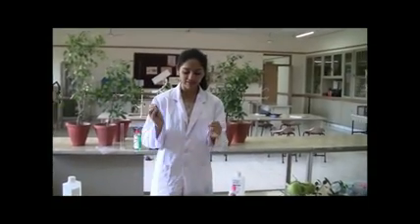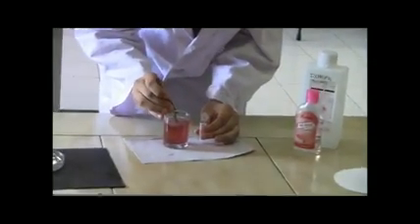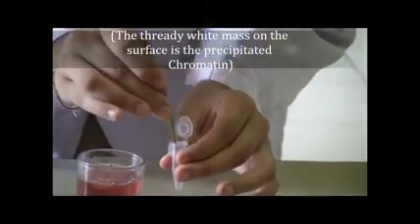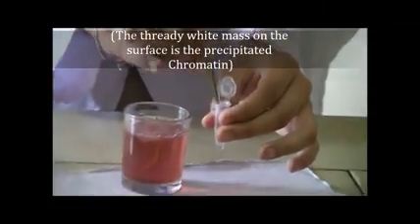Having obtained the precipitate, we now have to put the chromatin from the DNA extraction of the strawberry into a mini tube. This is going to be left for cooling to obtain the chromatin.